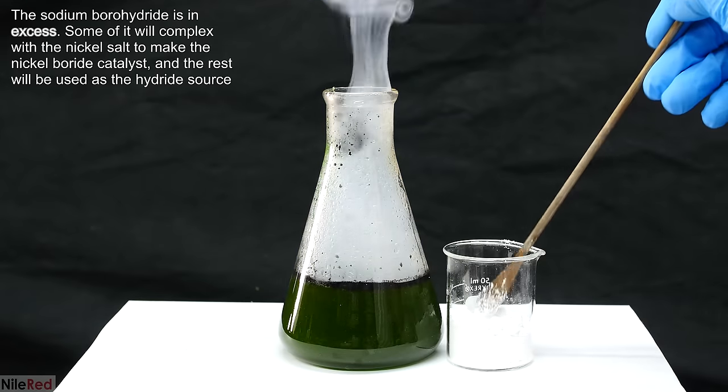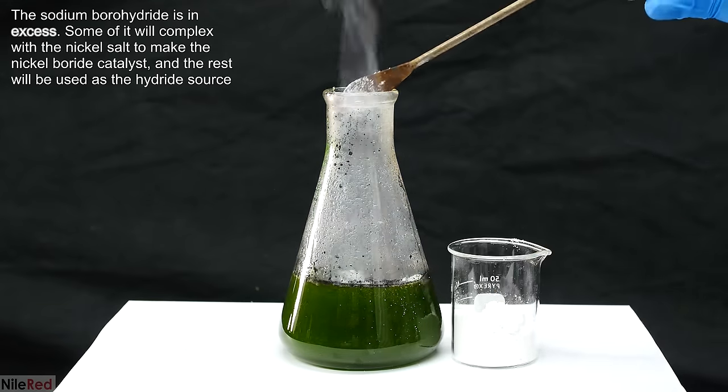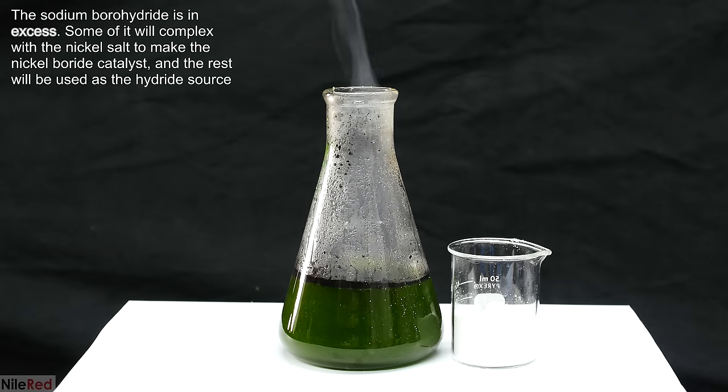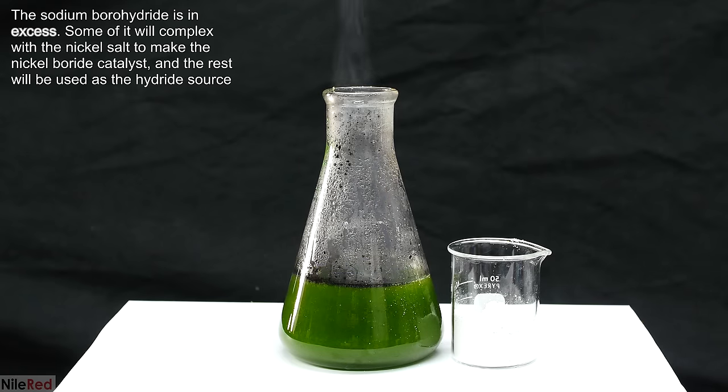The solution is originally very dark because we have a high concentration of nickel chloride, but as we add the sodium borohydride, we use up the nickel chloride and the solution lightens up. However, as we continue with the addition, we produce more nickel boride, which is a black solid, and the solution gets dark again.